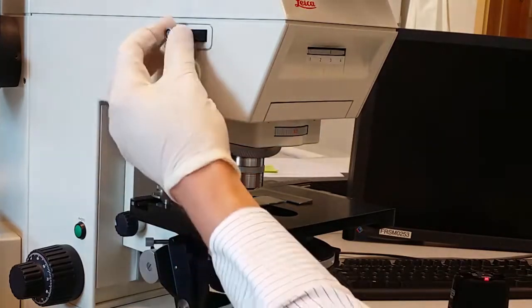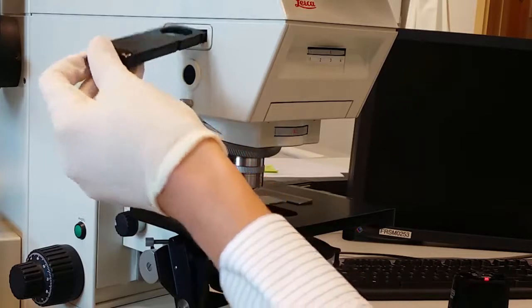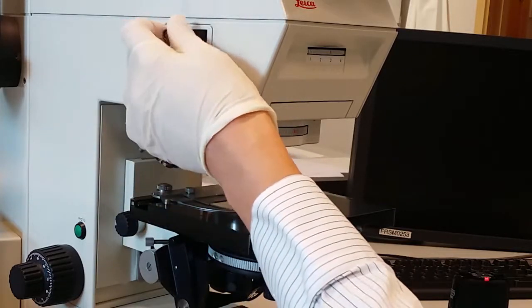And then I will change the polarizer and check so that it is the right way. So I put it in with the polarizing upwards. So here you see it. This is the differential interference contrast. And the most recognizable feature of this technique is that things start to look three-dimensional.